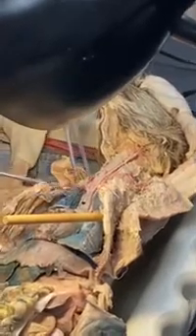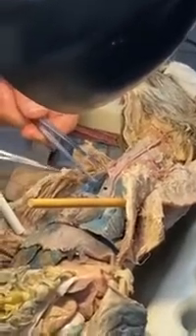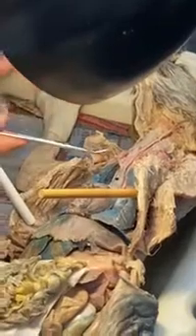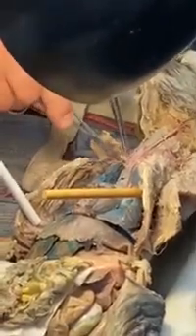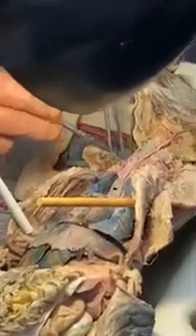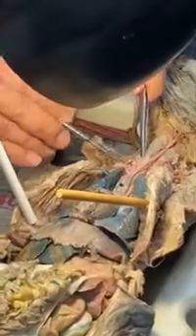IVCT. There it is, internal mammary. I actually managed to keep this one intact. So you can see it's gone to the subcutaneous tissue just underneath the breast tissue there. And that's why that's I. V, vertebral. And that's why that's disappearing in there. I need my probe for that one. There it is. It's disappearing.